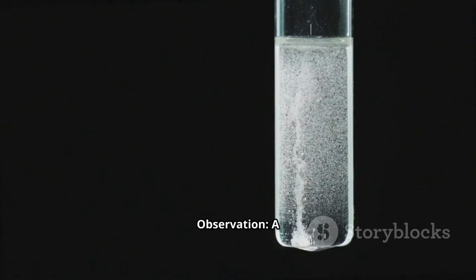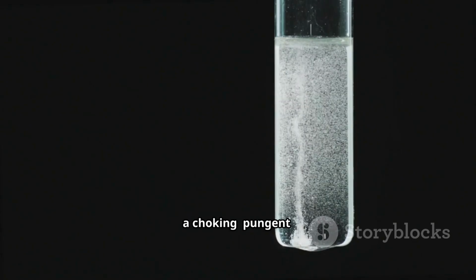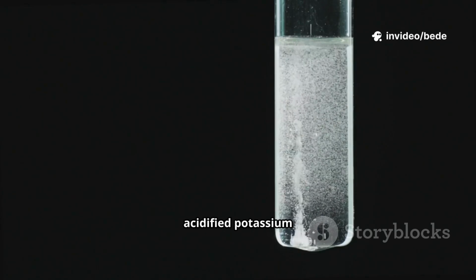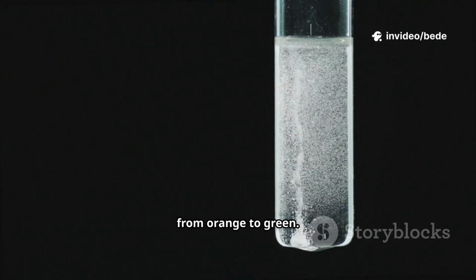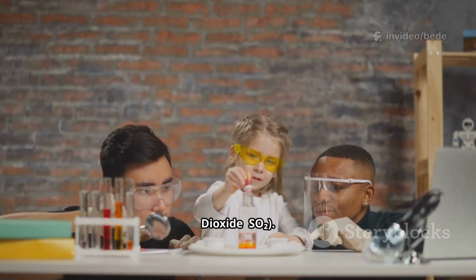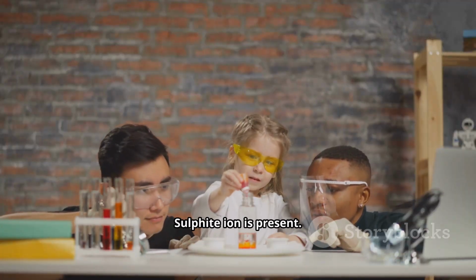2. Observation: a colorless gas with a choking, pungent smell like burning sulfur is produced. This gas turns acidified potassium dichromate paper from orange to green. Inference: the gas is sulfur dioxide, SO2. This confirms that sulphite ion is present.